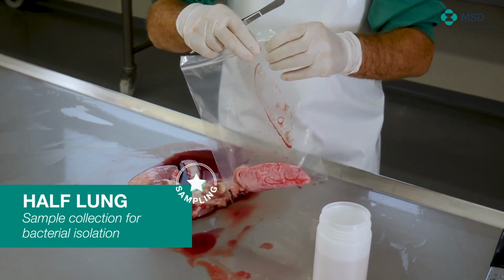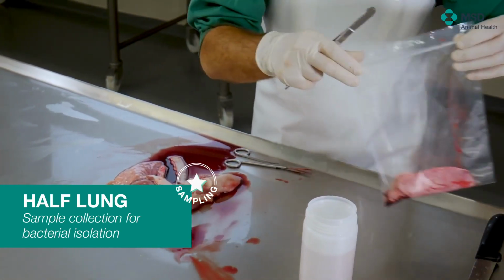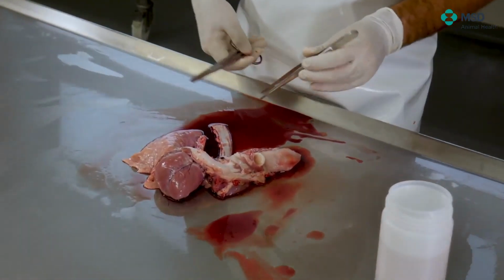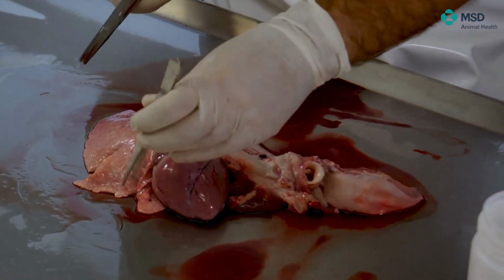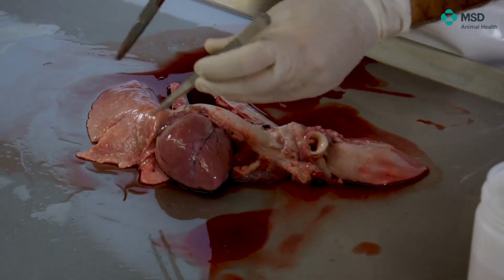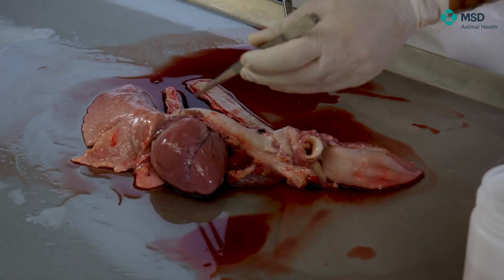So this would be an excellent sample to be submitted to the microbiology department. It's big enough to be sure that we can avoid contamination, because at the very end, as I told you, they will be burned. This is completely closed, and importantly, it will have to be annotated.